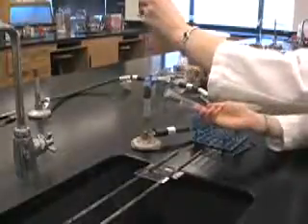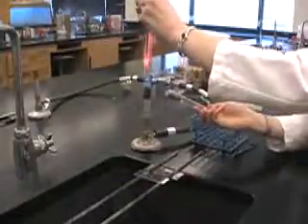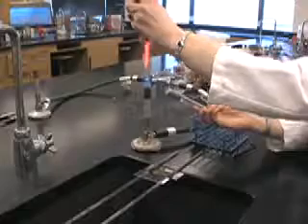Then you'll aseptically transfer a small amount of culture into the drop of water. A small amount is about the size of a head of a pin.